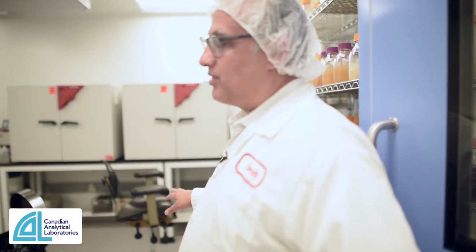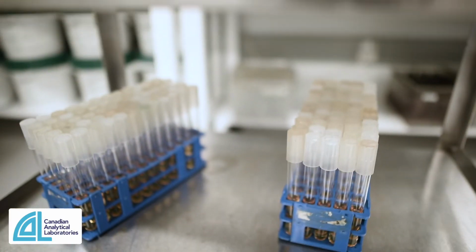So we do our media preparation in here. All of the plating is done under laminar flow hood conditions.